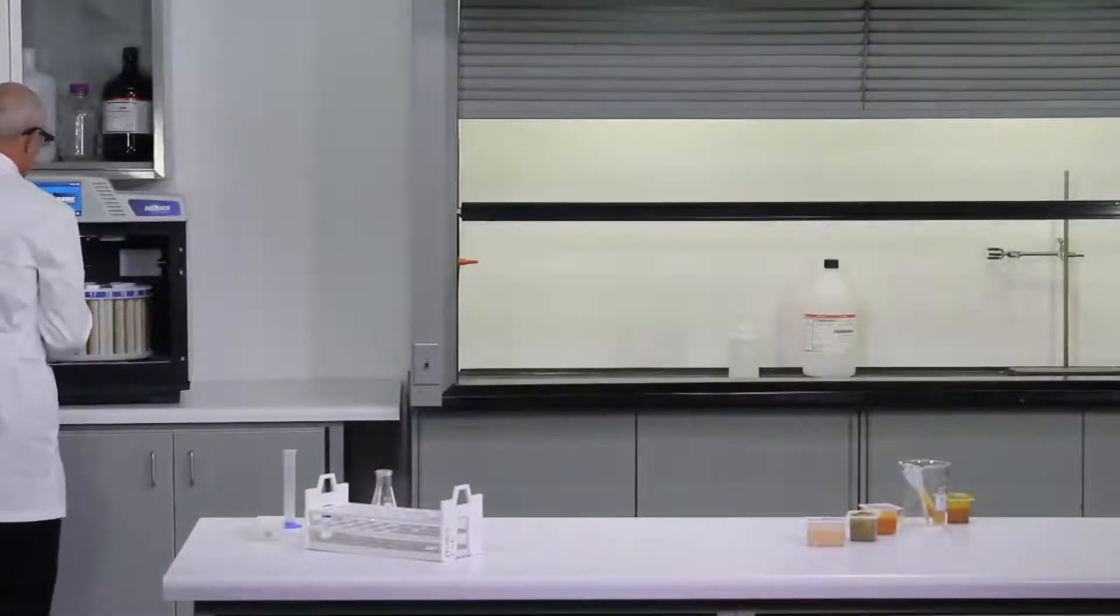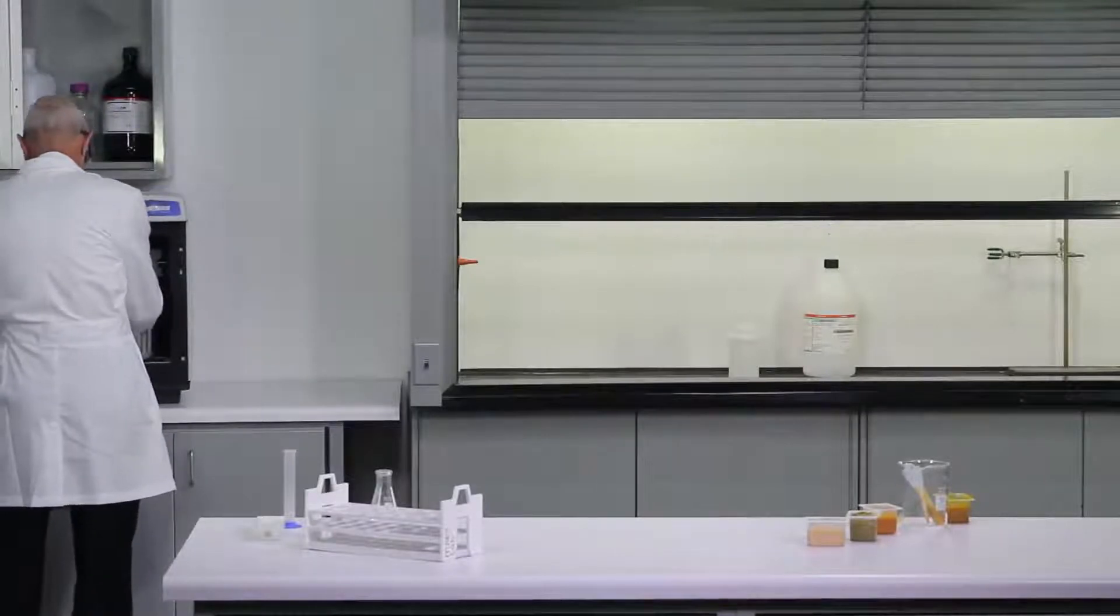Our sample is now completed and we'll bring it over to the hood and see what we have.